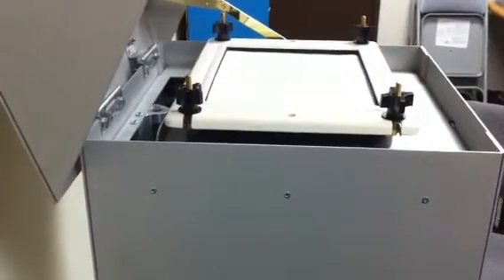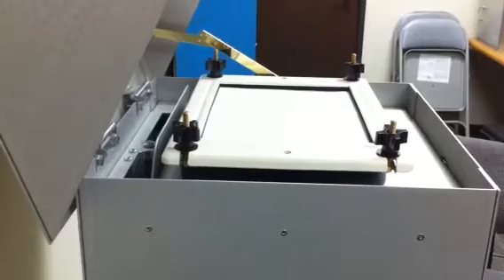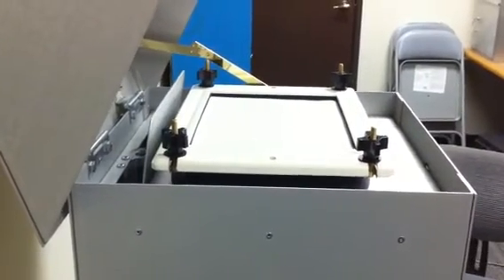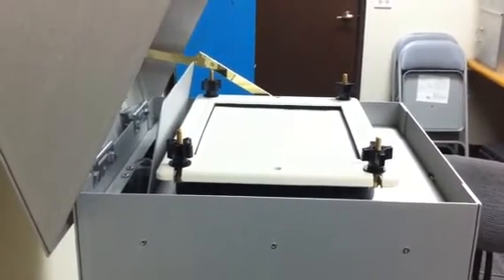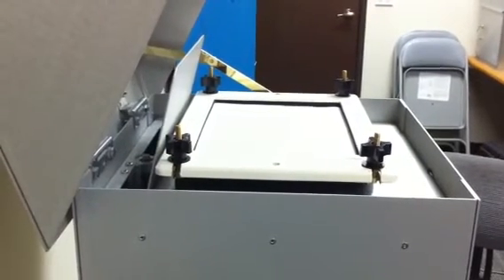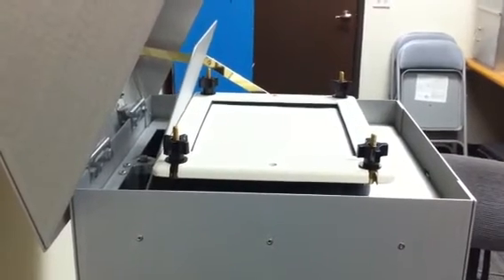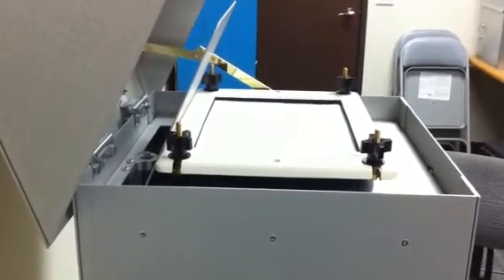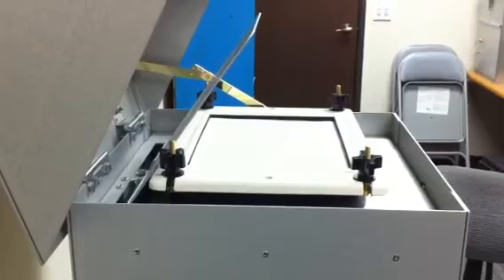With the switch in the on position, the default position for the filter shield is all the way up — in other words, it covers the filter paper completely. There are two limit switches on the top and bottom controlling the position of the filter shield, telling the controller when to stop moving it. As you can see, it's moving all the way to the top and it's about to close the filter paper.